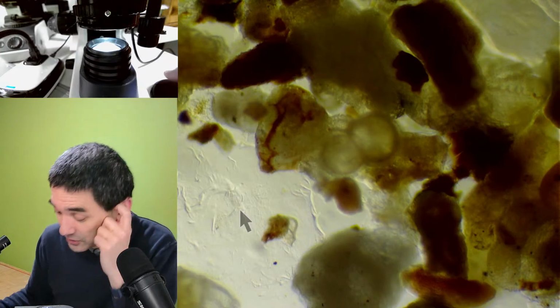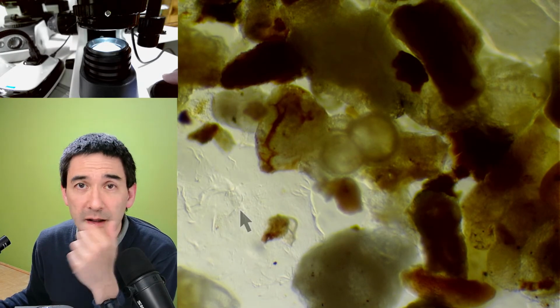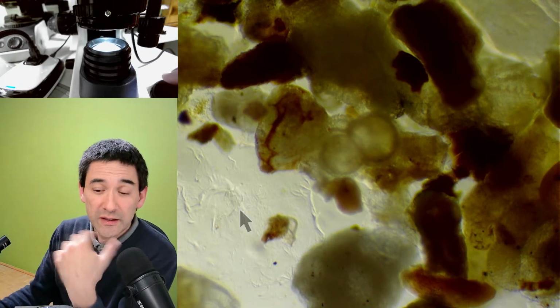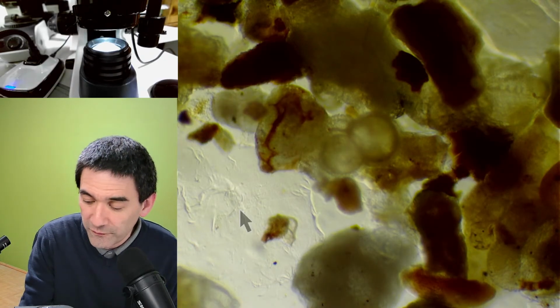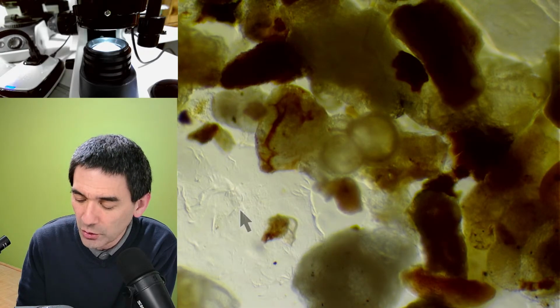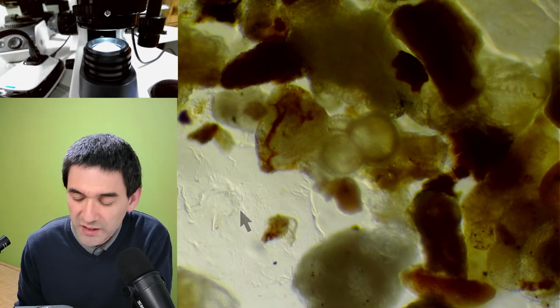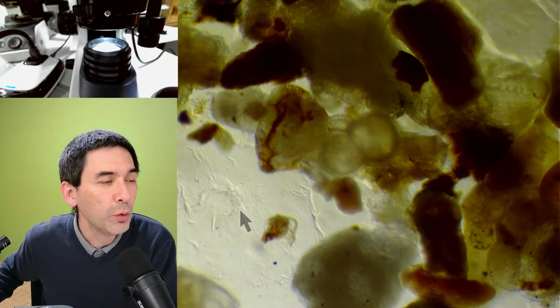So what I would like to do now is take again one of my, how do you call this, my cheek cells, because I also tried that, and actually the cheek cells are one of those examples which work surprisingly well, because cheek cells don't have much of a color, being very transparent. It's one example where oblique illumination works quite well.